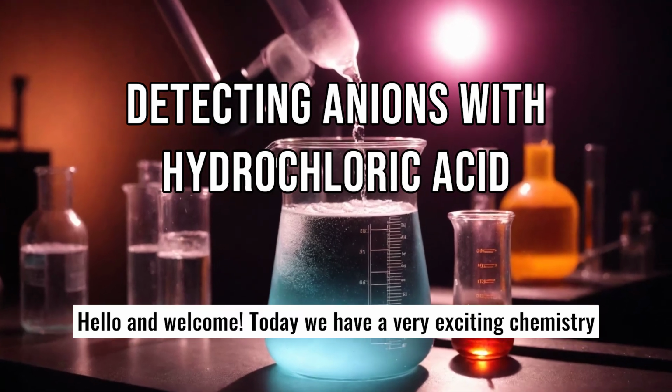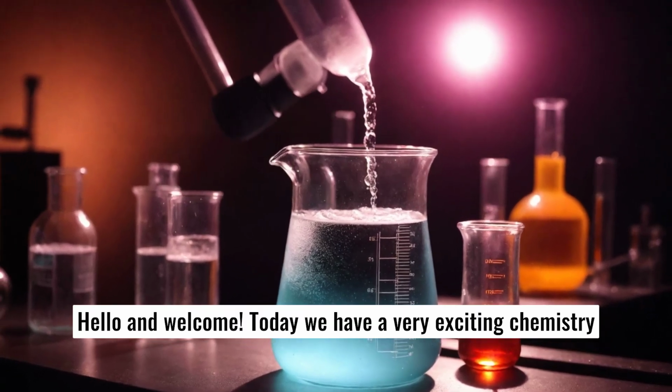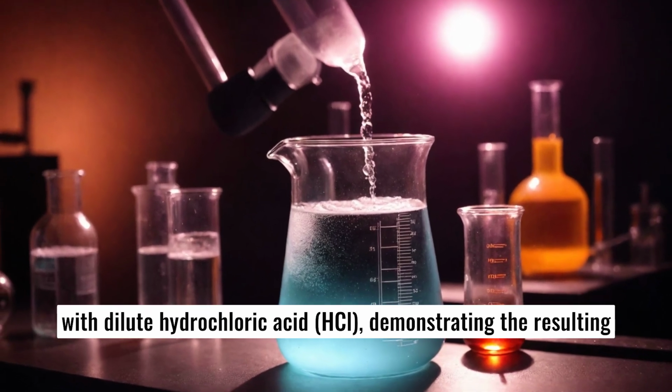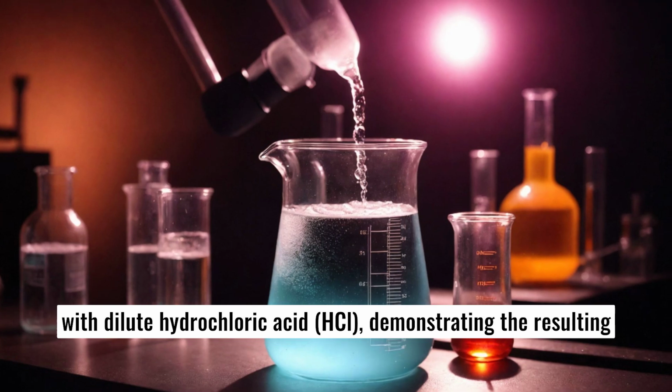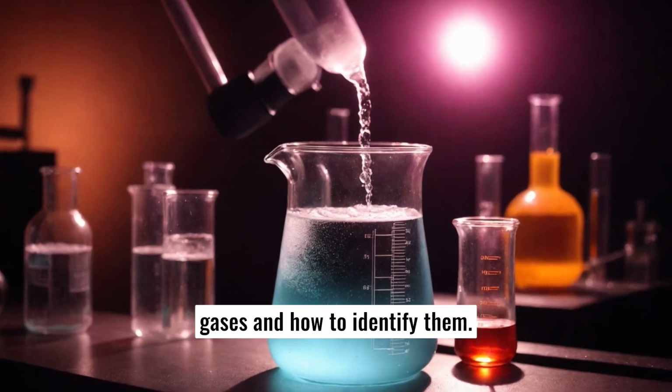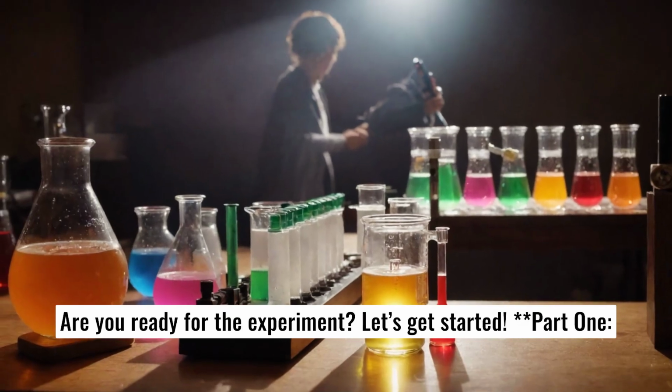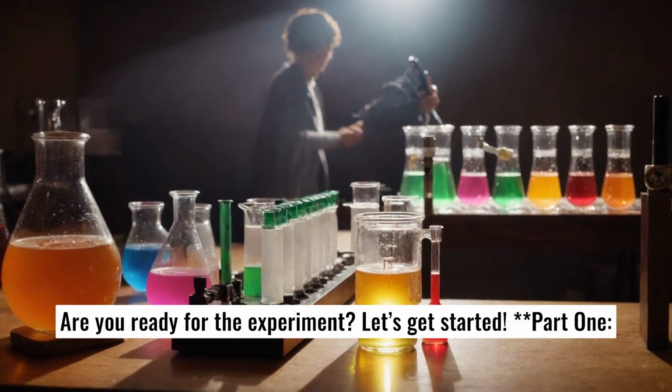Hello and welcome. Today we have a very exciting chemistry experiment where we will learn how to detect anions that react with dilute hydrochloric acid, HCl, demonstrating the resulting gases and how to identify them. Are you ready for the experiment? Let's get started. Part 1.